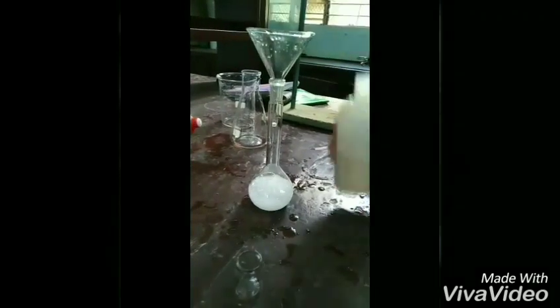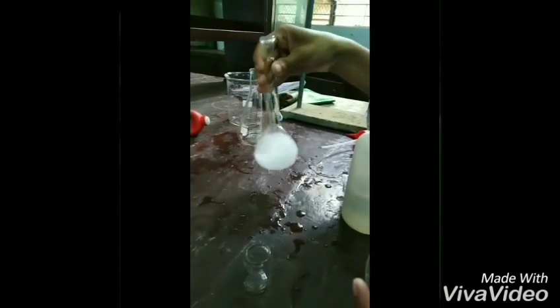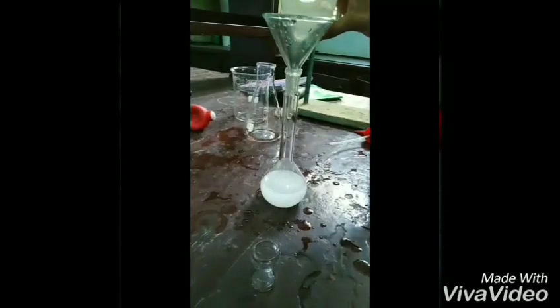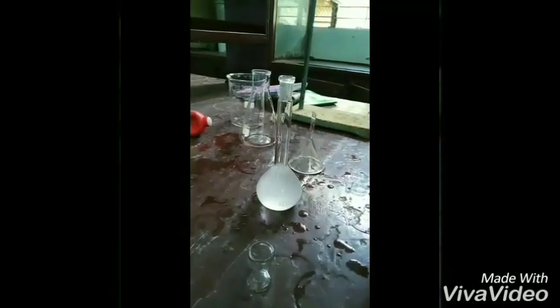For that purpose we have to prepare 0.05 molar EDTA solution in a 100 ml volumetric flask, and approximately 0.05 molar magnesium sulfate also in a 100 ml volumetric flask. The indicator used for this purpose is Eriochrome Black T (EBT).